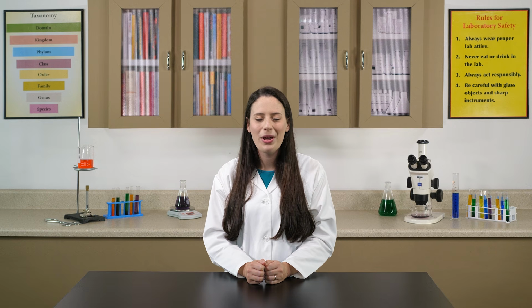A microscope is a piece of precision equipment, and if used properly, it can greatly enhance our study of biology. In our next lab, we will continue to work with the microscope as we begin to study microbiology. At this time, proceed with the corresponding activities.